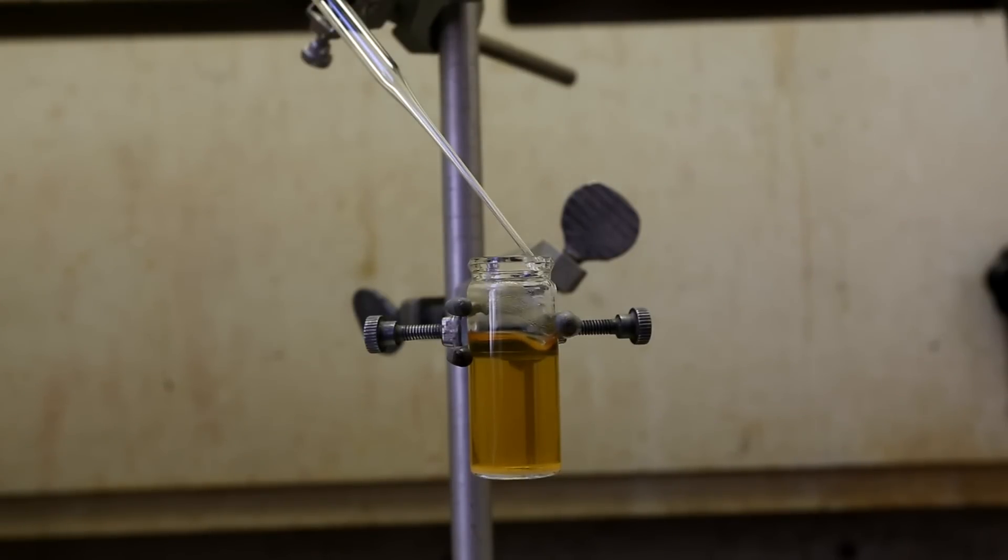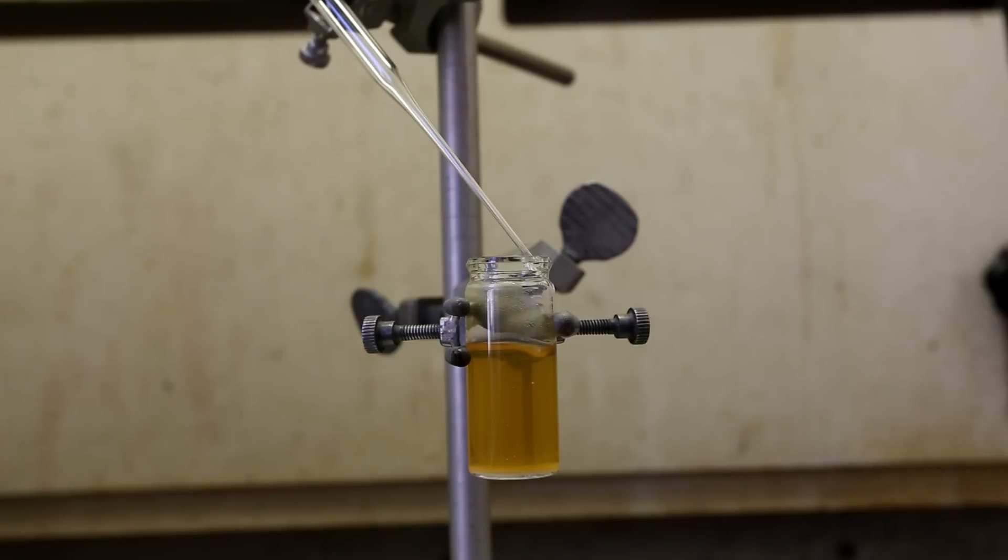As the solution evaporated, it looked like the particulate was going to be a problem and build up at the bottom, but once the vial was dry you can see that there was very little amount of particulate that was actually present.